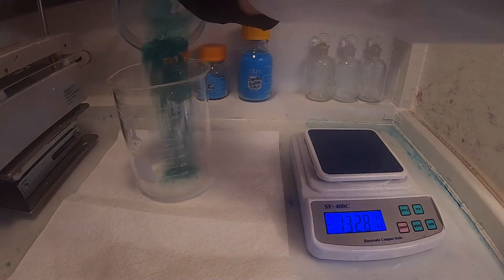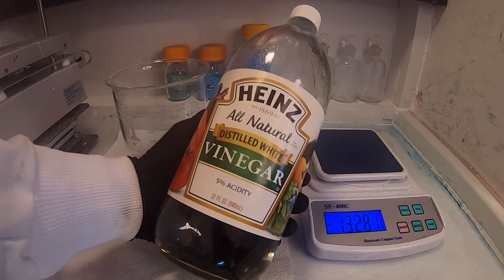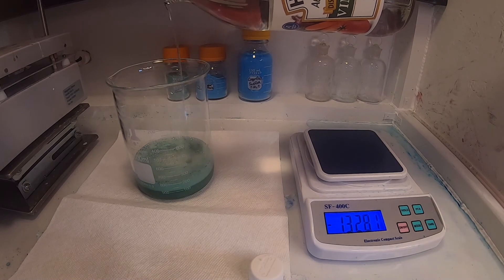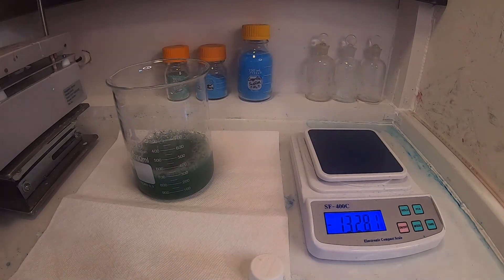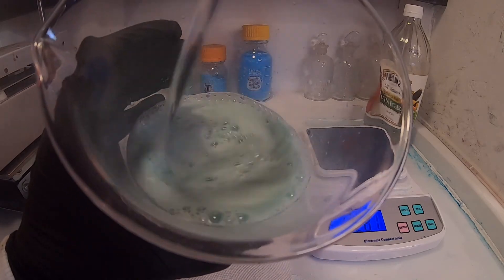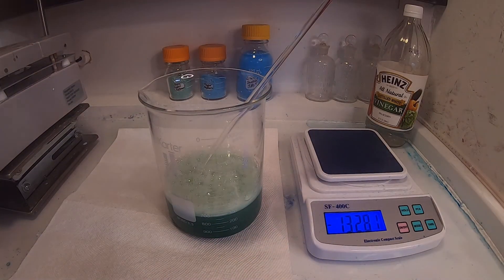I start by weighing 10 grams of basic copper carbonate. Then I disregard caution and start dumping 5% acetic acid. About 300 milliliters later, I start mixing the solution. As it mixes, more and more copper carbonate is reacting with the acetic acid.